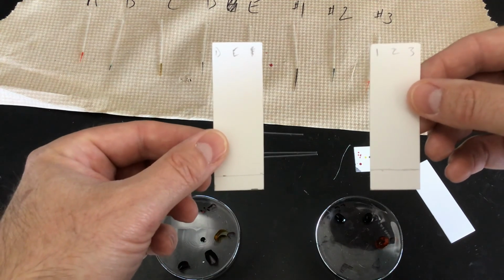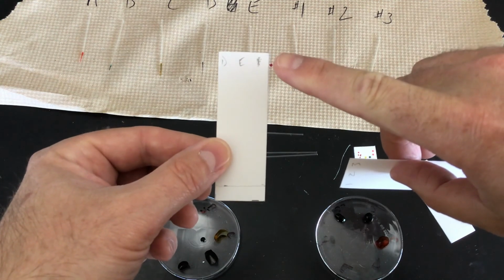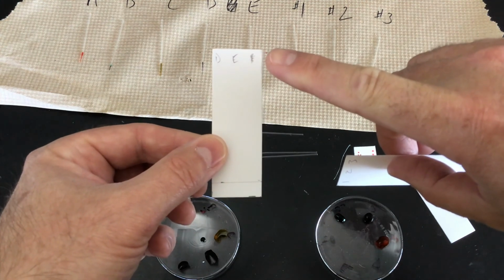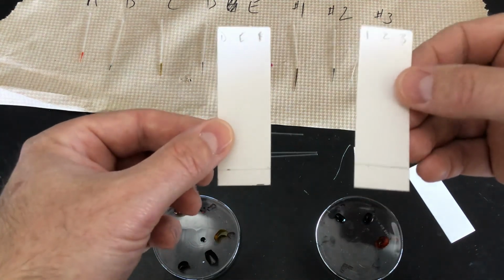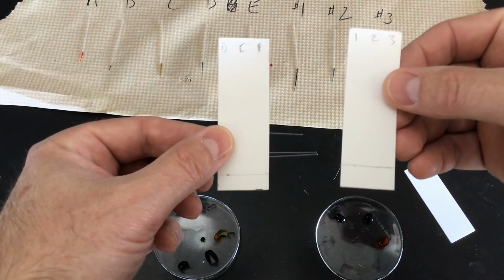If you were just doing, for instance, unknown number 1, where I've kind of scribbled it out here, as you would do in class, then you would just put whatever unknown you had, unknown number 1, 2, or 3, whichever your group was assigned. But again, since I'm doing all 3, I'm going to have a separate chromatography film here.